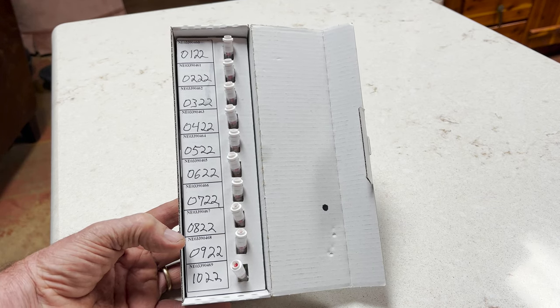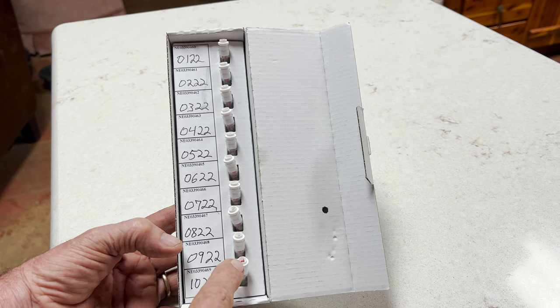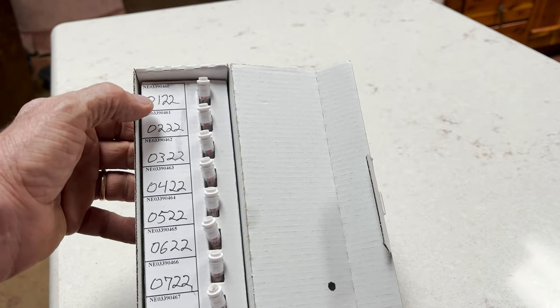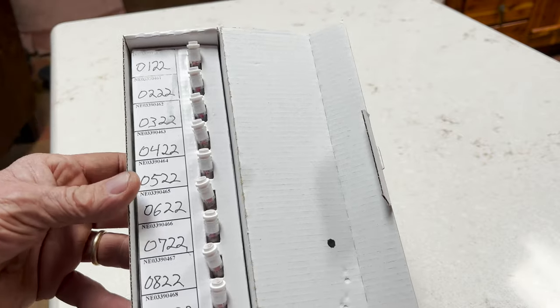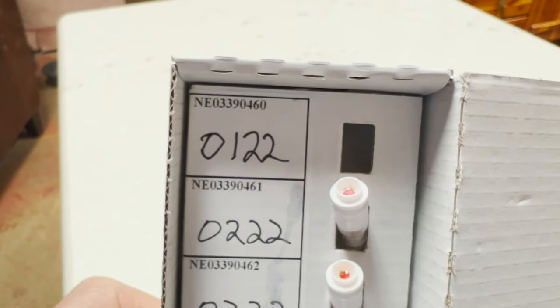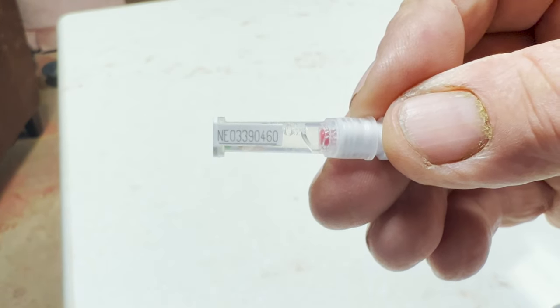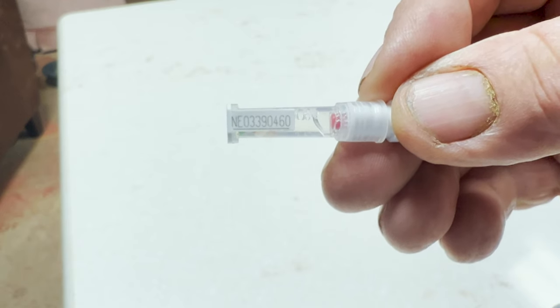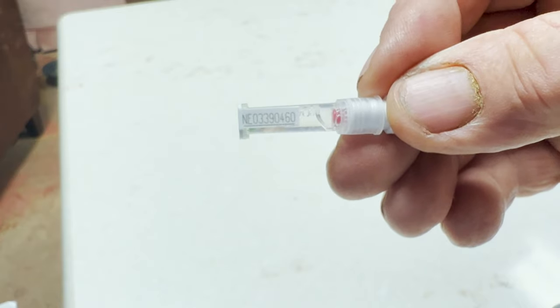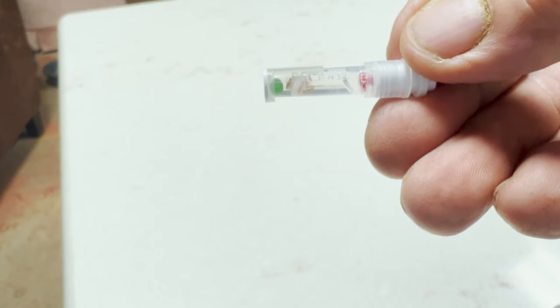When I unload the tube you can see it's foaming, which means the preservative is working on that tissue sample. There's a sample in the tube that's just as round as the needle — a round punch biopsy of the ear, very painless for these calves. After sampling, we place the little tube containing the ear sample in the mailing box. The calves are identified 1 through 10, and the tube number corresponds with the top number on the box — it ends in 460 on both, so we know everything's matched up. The lab will match it up as well.